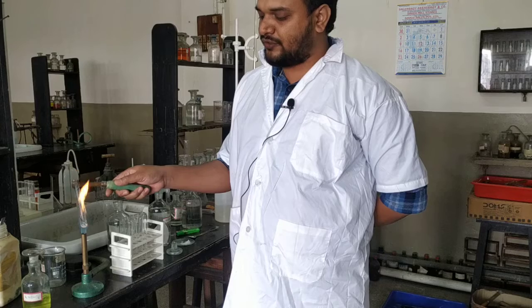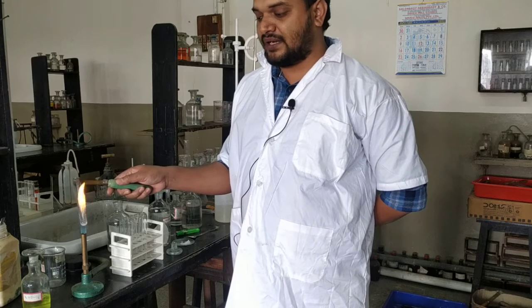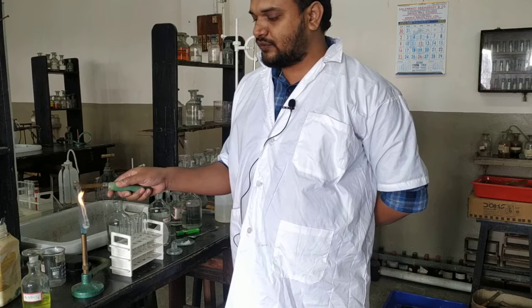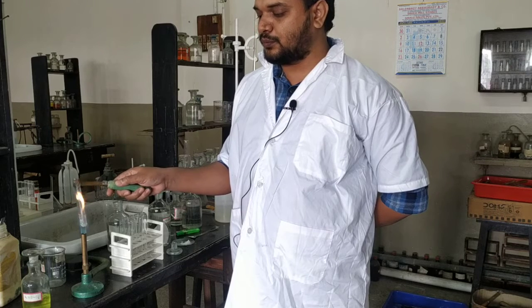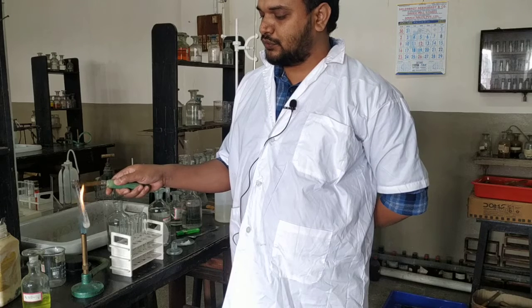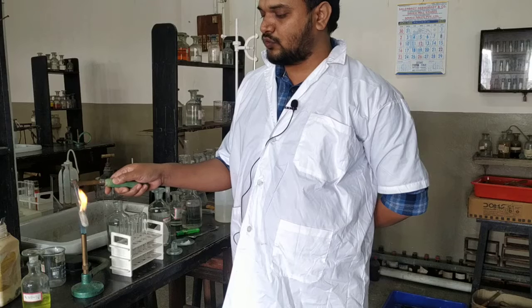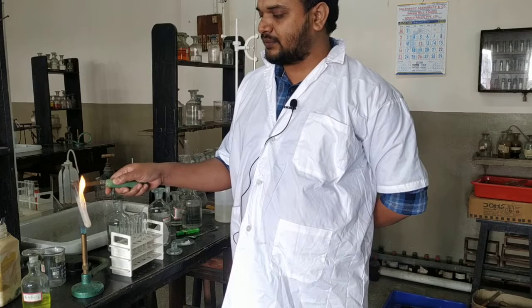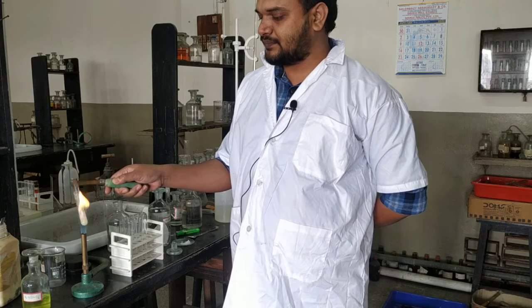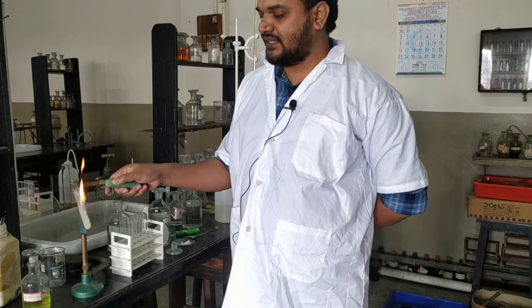Remember, you can write that a group 3 cation is present only if you can confirm group 0, group 1, group 2 absent. So you have to do the systematic analysis. This is known as formal group analysis. You can see from the mouth a gas is coming. But if it has a pungent odor, then we say it is group 0.